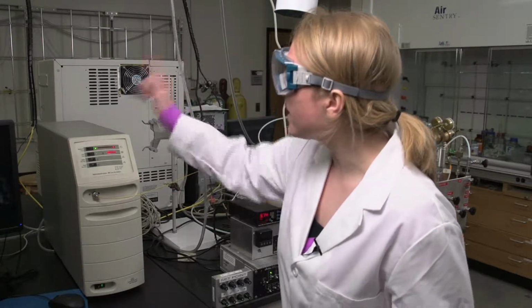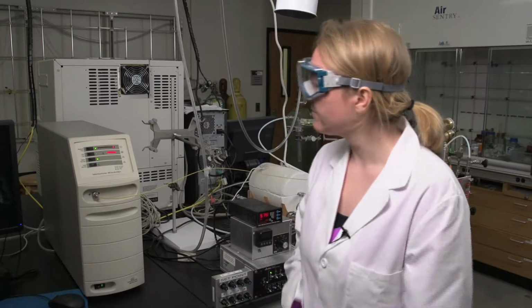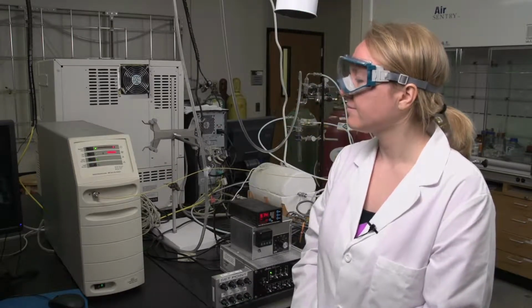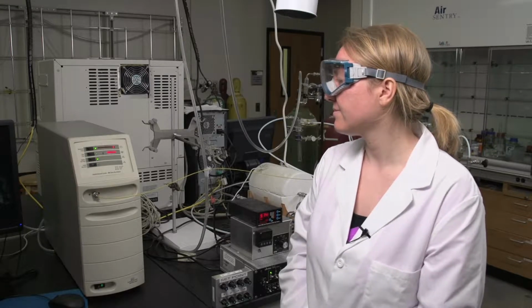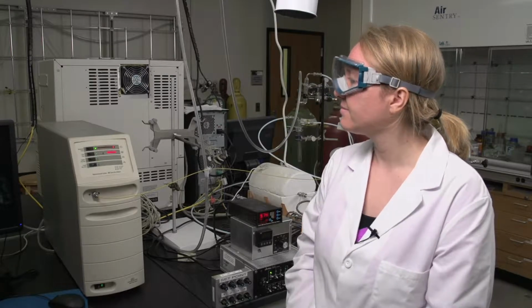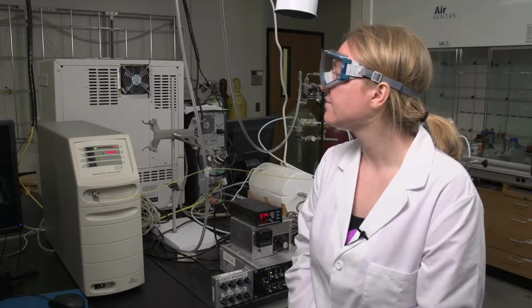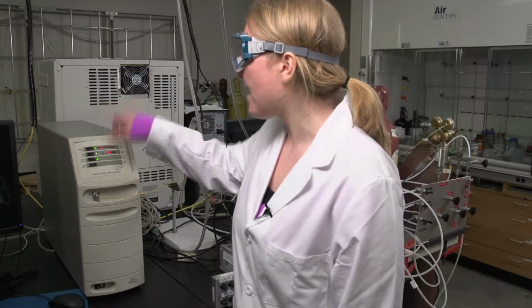So since it's not blinking, we can go ahead and turn on the capillary flow valve. When the pressure has reached between 1 and 2 millibar and the current will begin to drop, and then you can turn on the last rocker switch, which is the sample inlet valve.